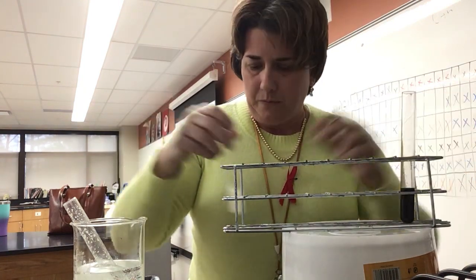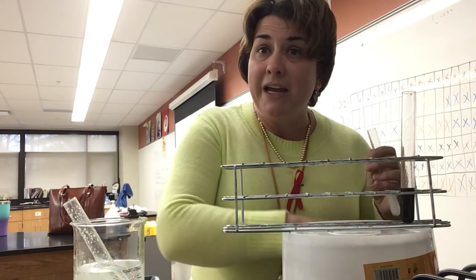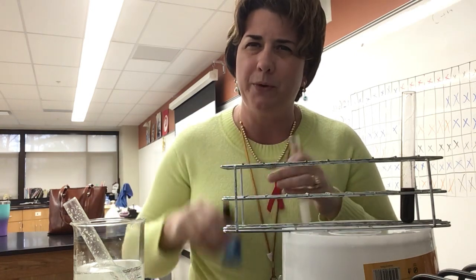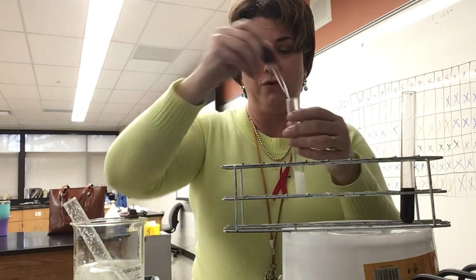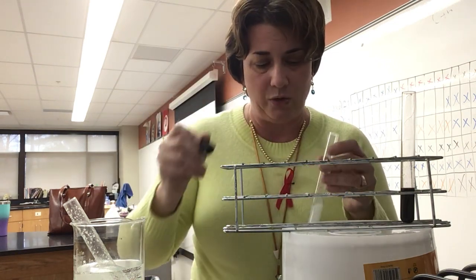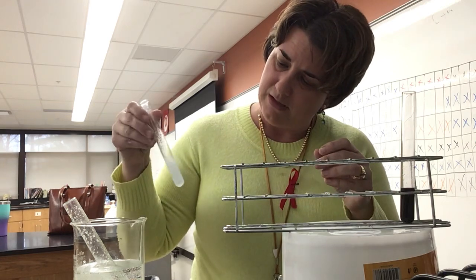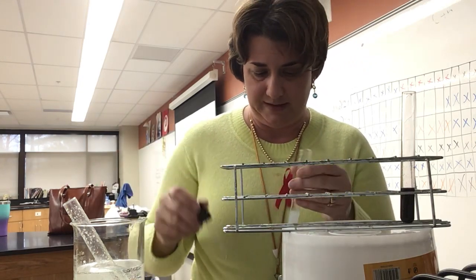Now, our Biuret tests for protein, as I said before. A negative test is that it will stay blue, and a positive test is that it will change to a purple or maybe mauve, I think is the way I described it. So I'm going to add a little extra of the Biuret, it's a little light. Just to make sure we're actually seeing the color, I'm going to add 3 dropperfuls. I might even add a little bit more so it's a little easier to see.